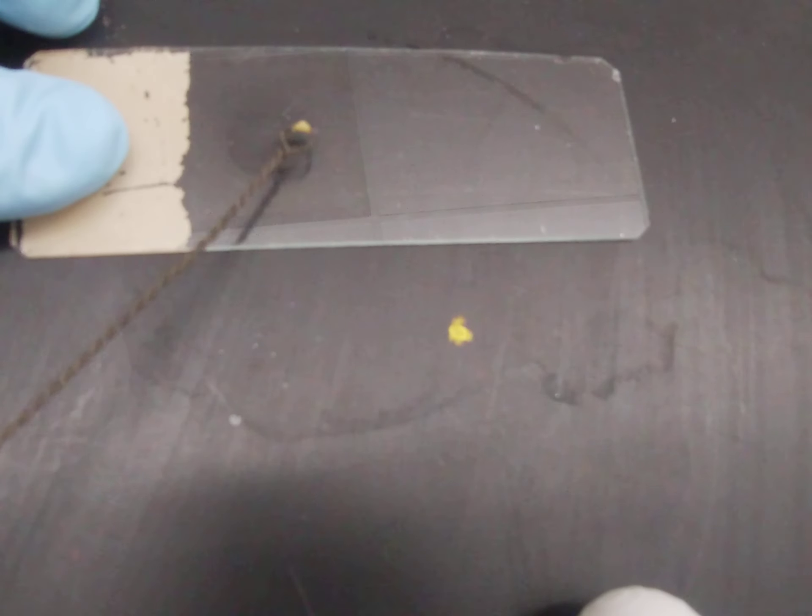You always want to make sure that you add the bacteria to the slide before adding the hydrogen peroxide, because the loop itself can cause bubbles to form. Mix the bacteria directly onto the slide, incinerating your loop afterwards to get rid of the organisms.